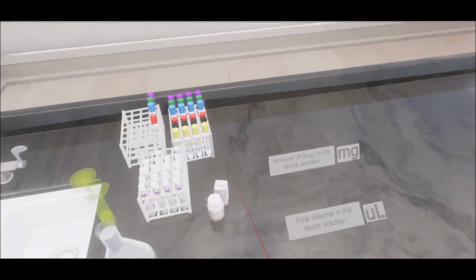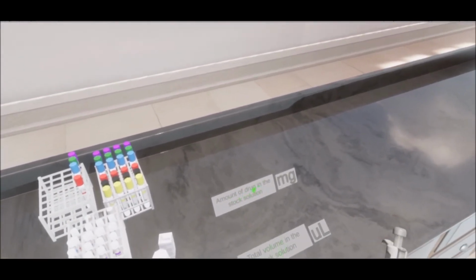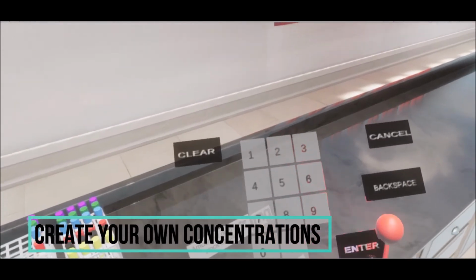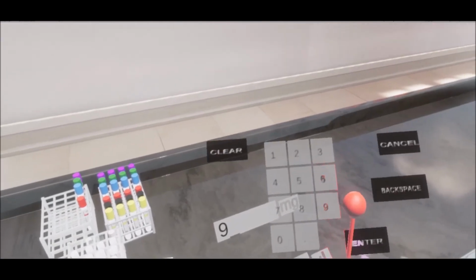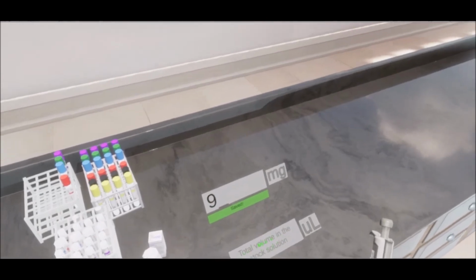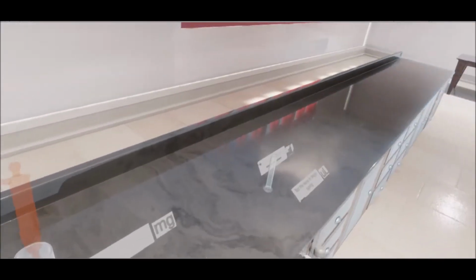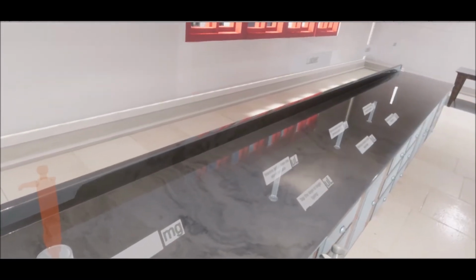In the drug dilution station, students can create the stock solution of drug of different concentrations by entering different amounts of drug and volume of solvent into the keypad. Students can then create a serial dilution of drugs from the stock solution.